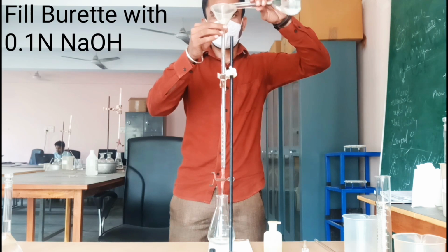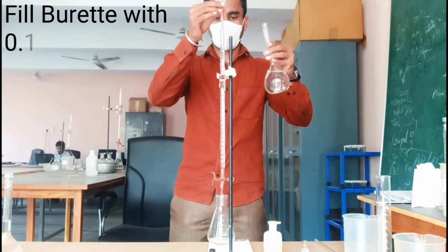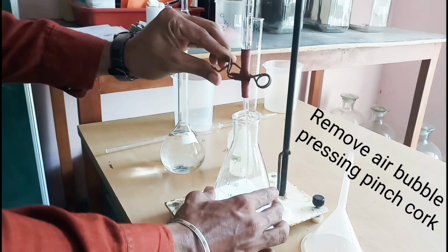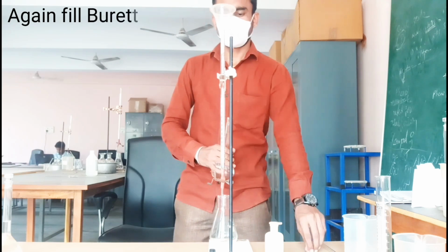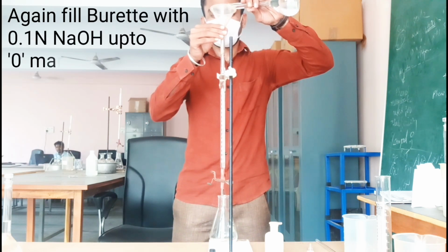Fill burette with 0.1 normal NaOH. Remove air bubble pressing pinch cork. Again fill burette with 0.1 normal NaOH up to 0 mark.